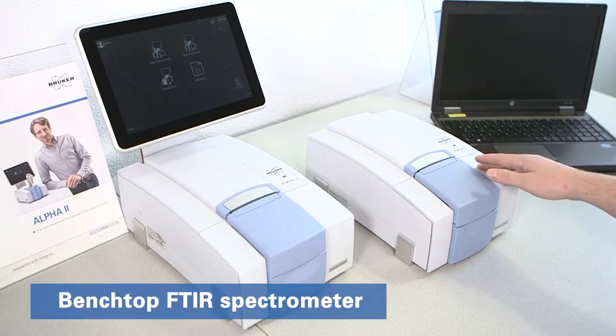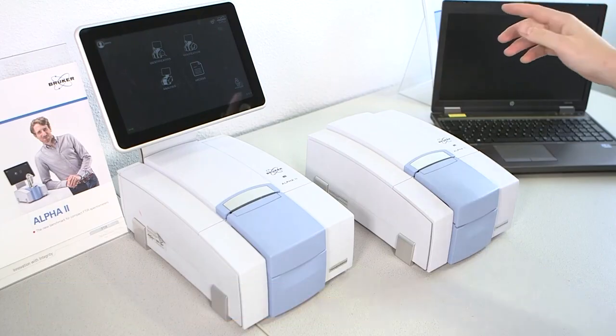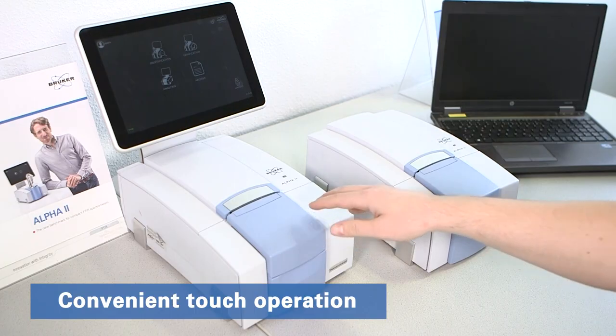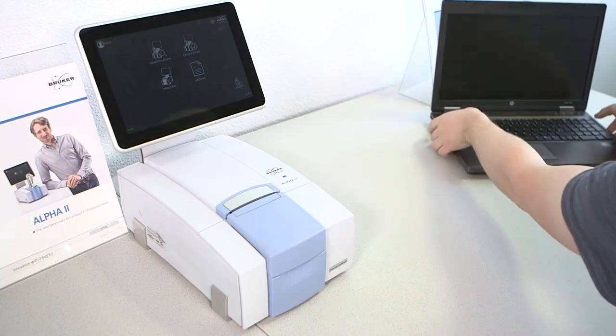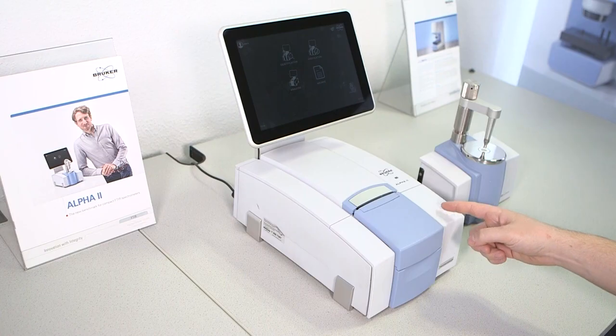FTIR spectrometers come in many shapes and sizes. Conventional FTIR instruments are usually controlled with a laptop or desktop PC. More recently, however, touchscreen operation was introduced and has since revolutionized the user experience in infrared spectroscopy. For this series of educational FTIR videos, we are using an Alpha 2 operated by Opus Touch.